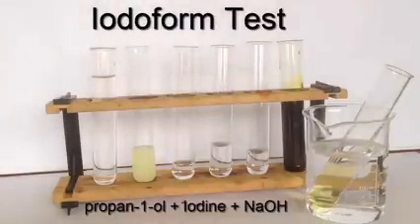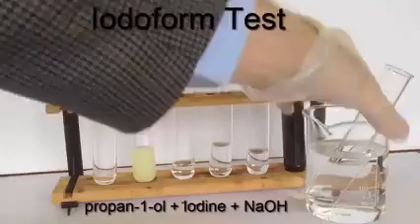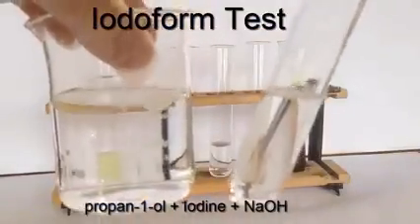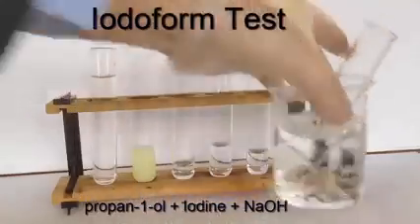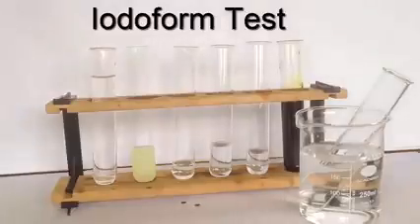Still a little bit brown, but watch what happens when it goes into the boiling water. You can already see there, I hope, that it's gone colorless and clear. That's a negative test. So with propan-1-ol, we have a negative result for the iodoform reaction.